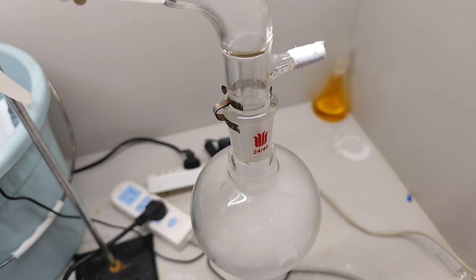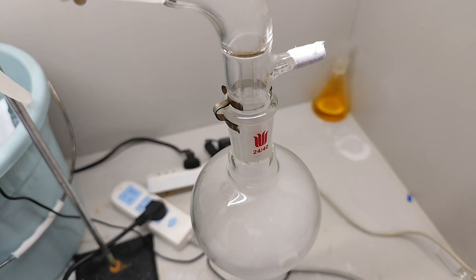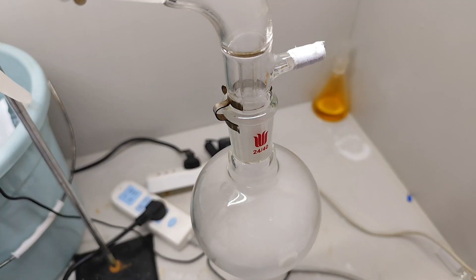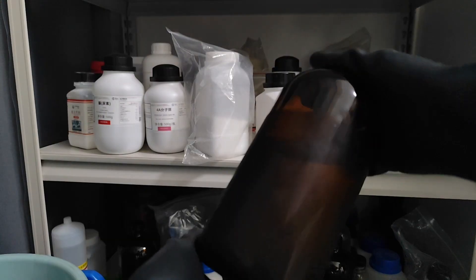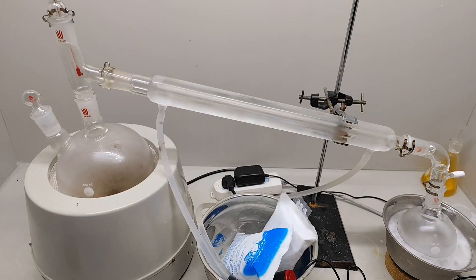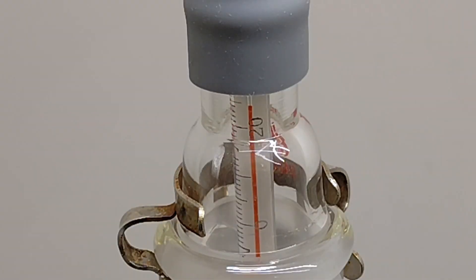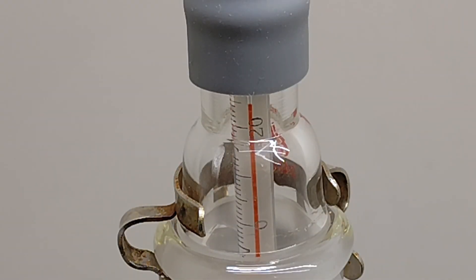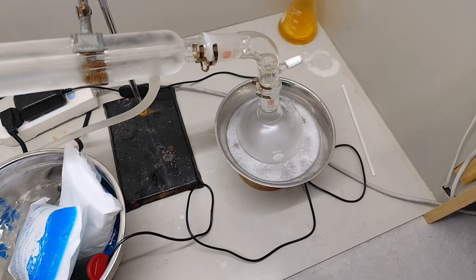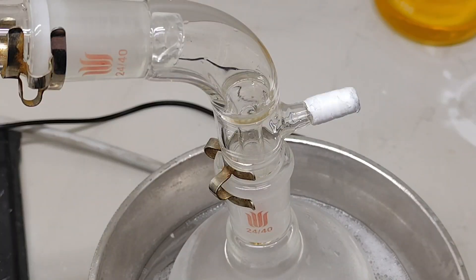Since the boiling point of acetaldehyde is around 20°C, dry ice is placed in the receiving flask to prevent the product from escaping. I obtained about 800 mL of raw acetaldehyde. To purify it, I perform a simple distillation and collect fractions around 20°C. To increase yield, the receiving flask is cooled to about −78°C using a dry ice and ethanol mixture. After distillation, I have about 600 mL of pure acetaldehyde.